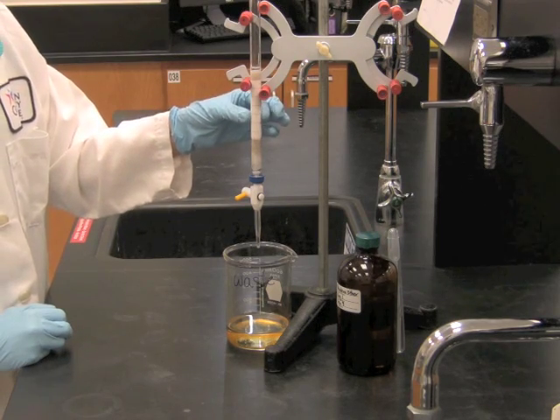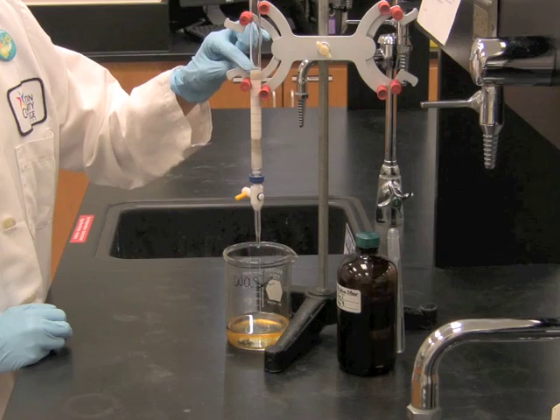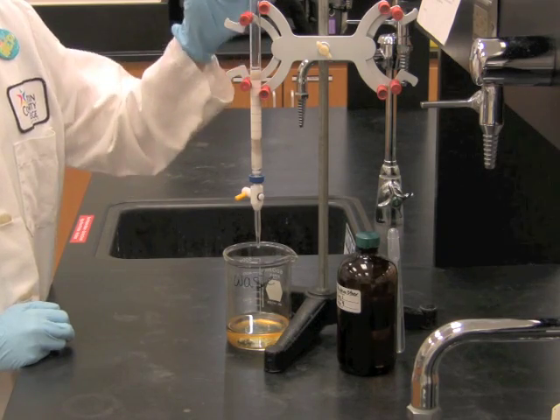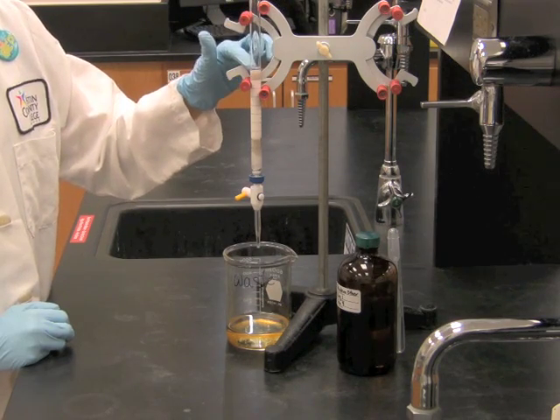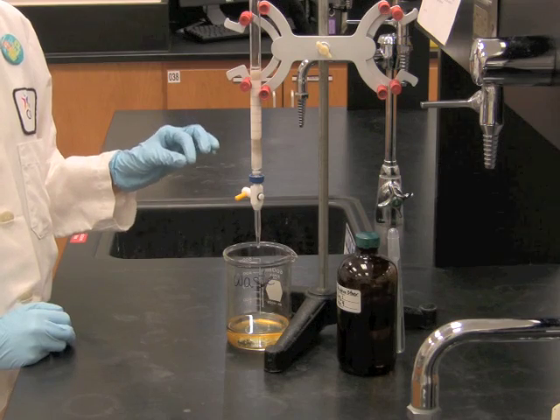Once your alumina settles, add one more centimeter of sand to the top of the column and let the solvent drain until it is just about even with the top of the sand.